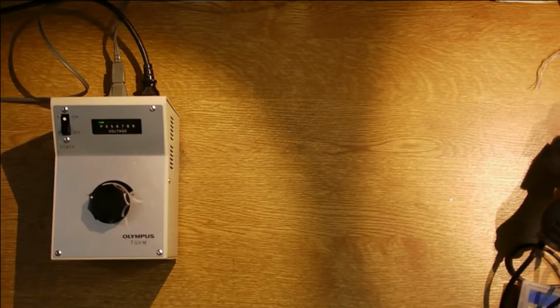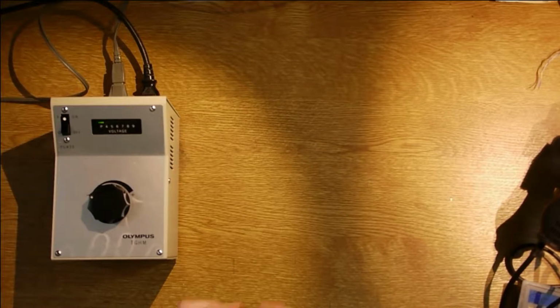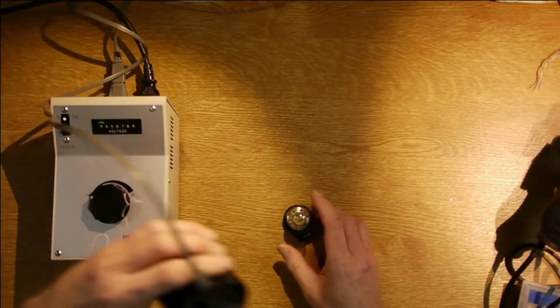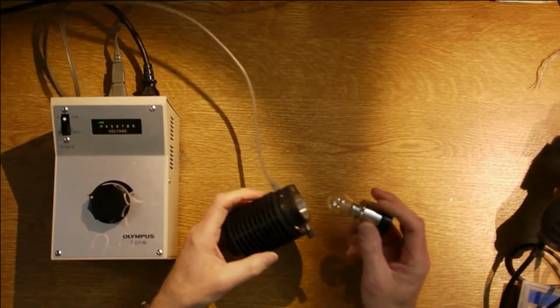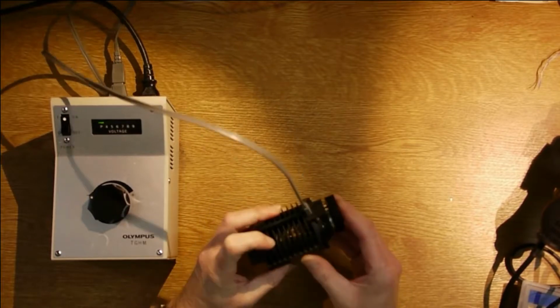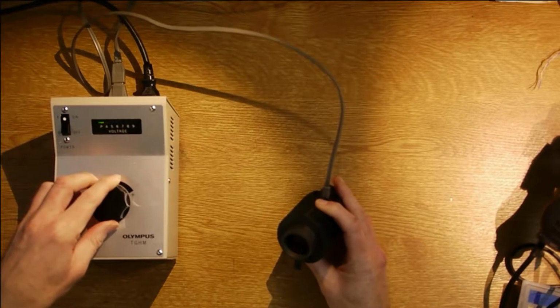I've got an Olympus BHM metallurgical microscope, and this is the power supply that powers the illumination system. When I got the microscope, the illumination system was based on this bulb, which slides into this assembly here. So that plugs in there, and then the bulb illuminates.